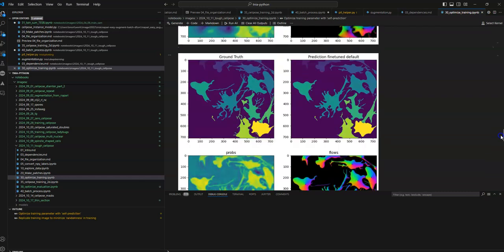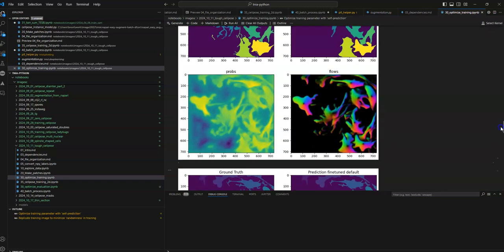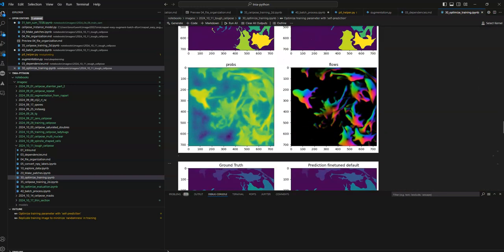And now here is a nice piece of information. Just retraining while drawing these protrusions a little better does make a pretty big difference, I think. With default Cellpose settings, it is finding more protrusions once I redraw them. And we can look here at the probabilities and the flows. They're a little bit fuzzy because of the rescaling.